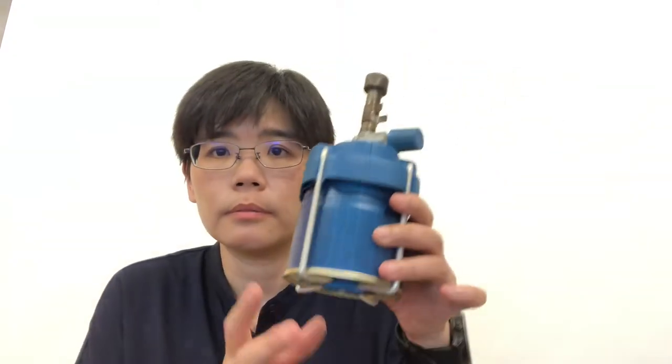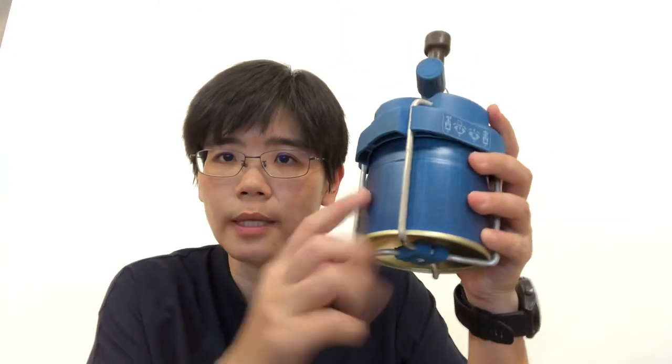Hi! In this video, I will be introducing the steps to turn on the portable Bunsen burner safely in the lab. This is the portable Bunsen burner. This part, the canister, is the fuel that we will use to light up the fire.